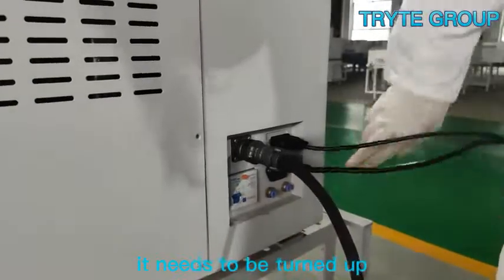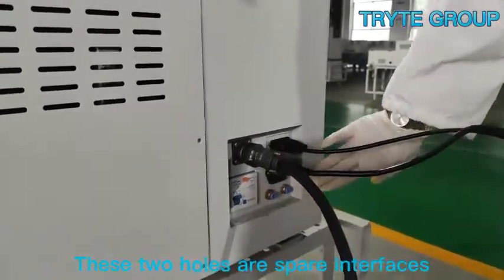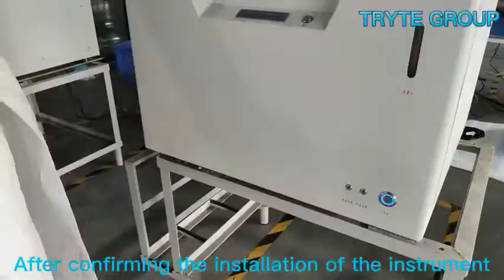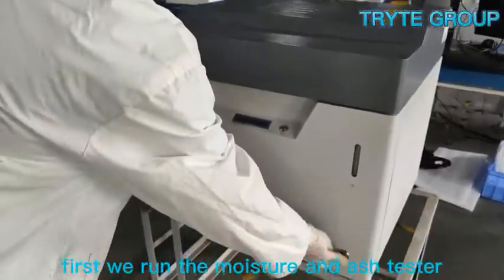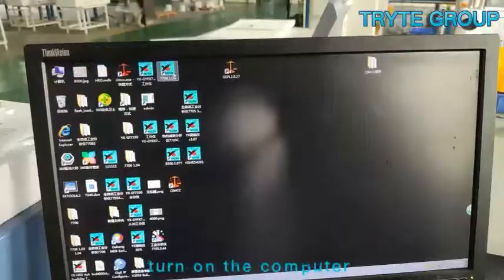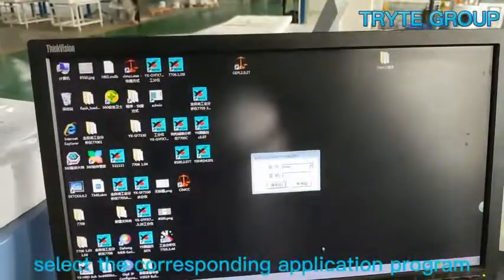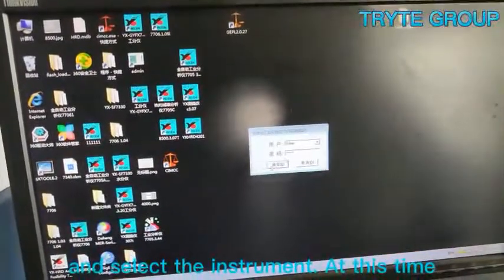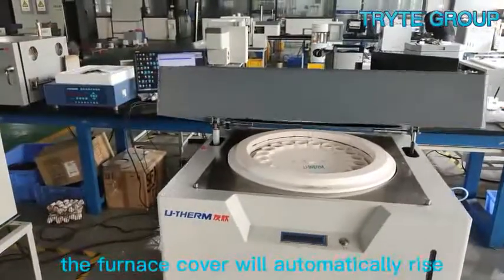When the instrument is running, the switch needs to be turned up. These two holes are spare interfaces. After confirming the installation, first run the moisture and ash tester: turn on the electrical power switch, turn on the computer, select the corresponding application program, and select the instrument. At this time, the furnace cover will automatically rise.